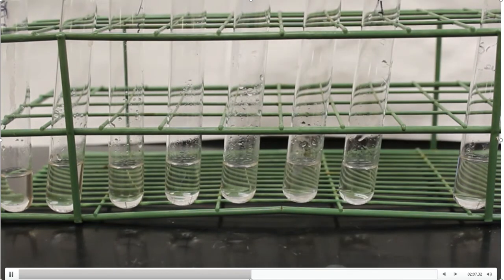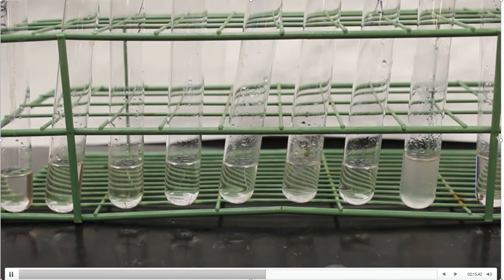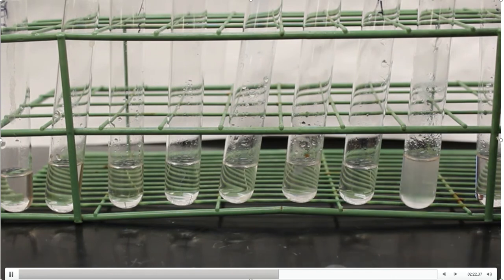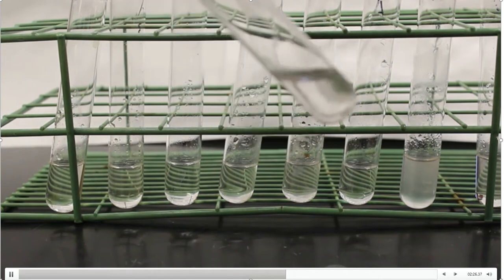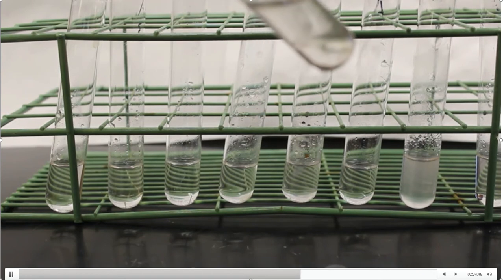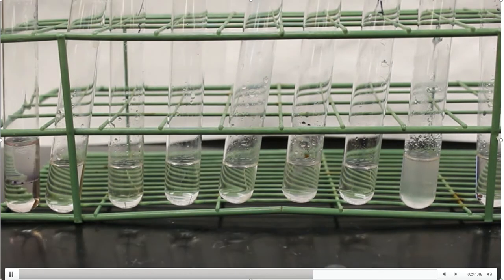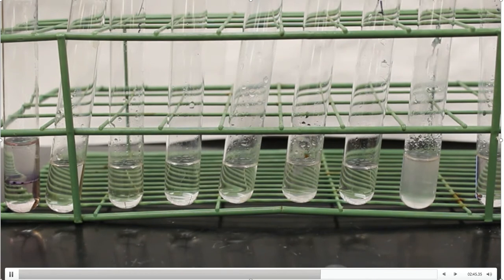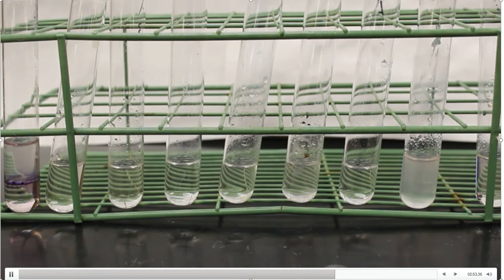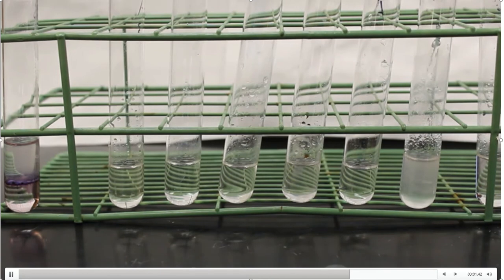Maybe your data sheet is going to ask for initial observations, so write those down. Then we'll add our sulfuric acid. The lab directions say to add it slowly on the sides and allow it to drain down to the bottom, but not necessarily mix them. So I'm going to slowly allow the sulfuric acid to drain to the bottom, sit it here, and allow it to do its thing. You're probably already seeing something happen in that very first tube — so take a look at it.